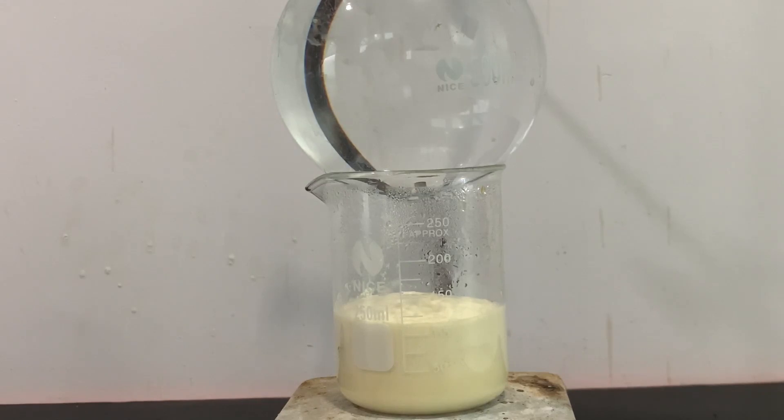To ensure an acceptable yield, the reaction has to be pushed forward by refluxing it. I didn't reflux it long enough because the mixture started to foam a lot and it almost overflowed, which is why I took it off the heat.